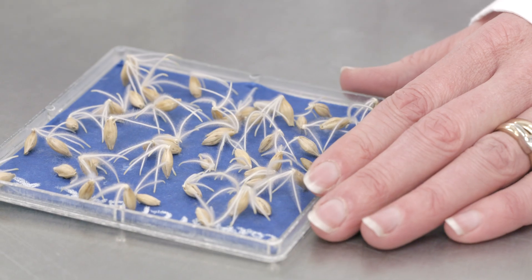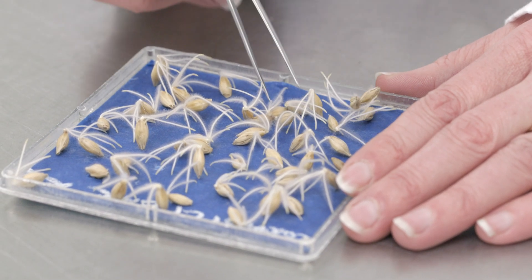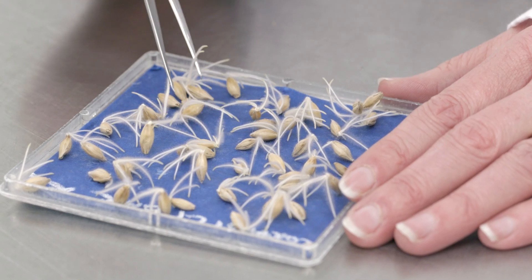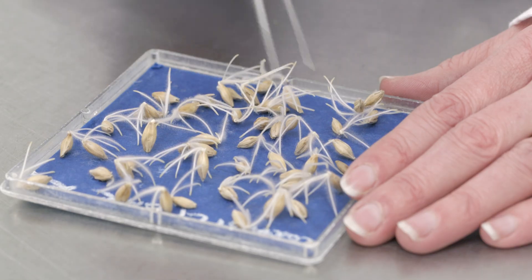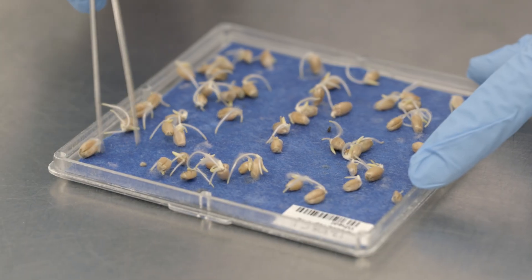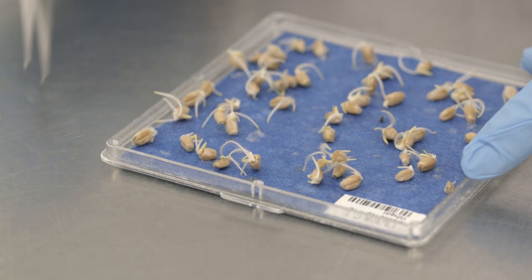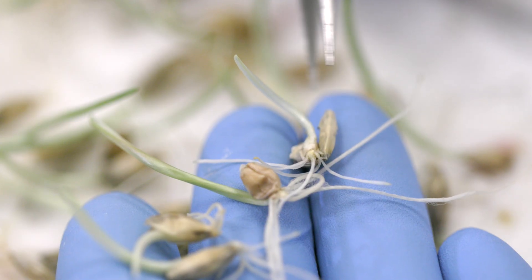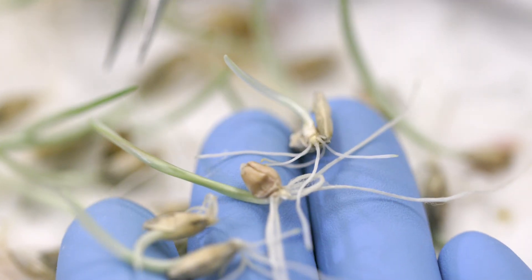Normal seedlings possess all the essential structures indicative of their ability to produce normal mature plants under favourable field conditions. In this case, we have normal seedlings mixed in with seedlings that will be incapable of growth later on as they are already in a state of deterioration, and seedlings that have damaged roots due to having previously sprouted in the field.